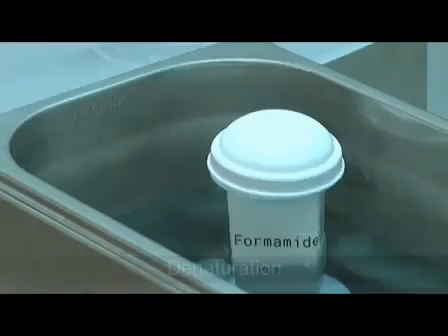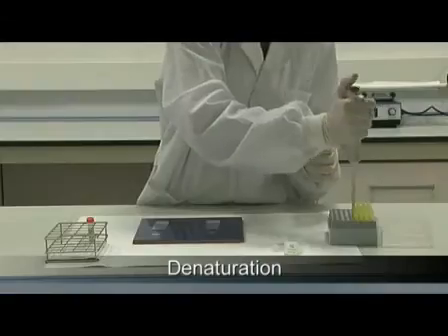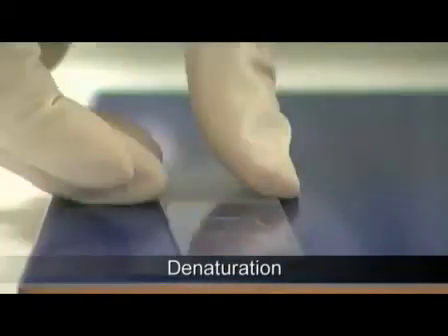Whereas the denaturation of the sperm sample is mandatory, the probe denaturation must be adapted to the manufacturer's indications.